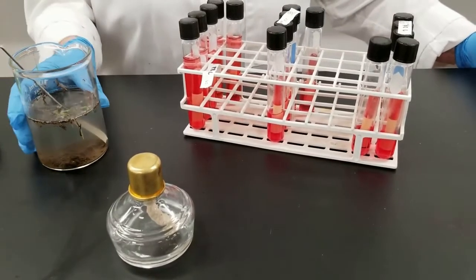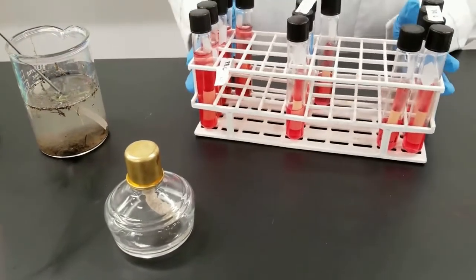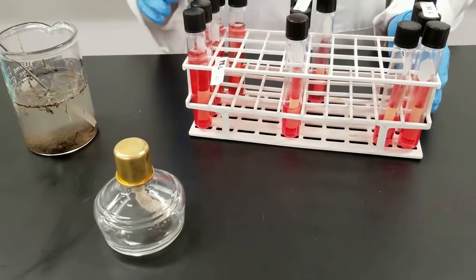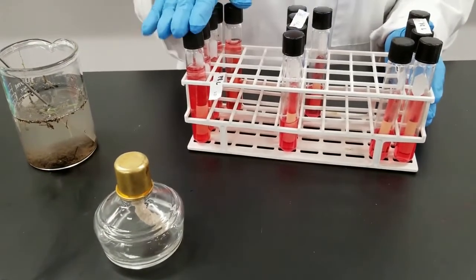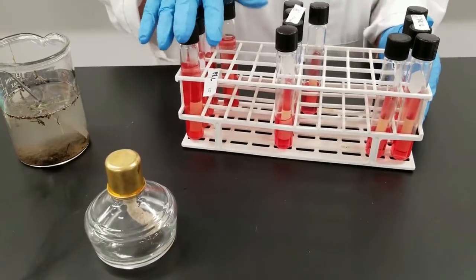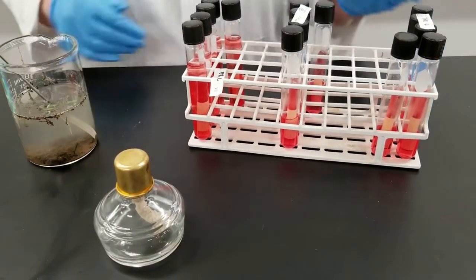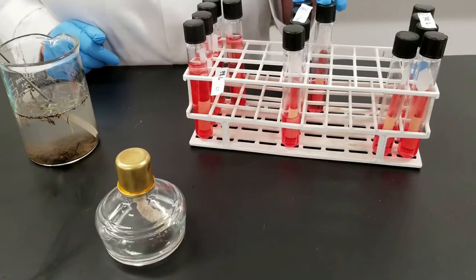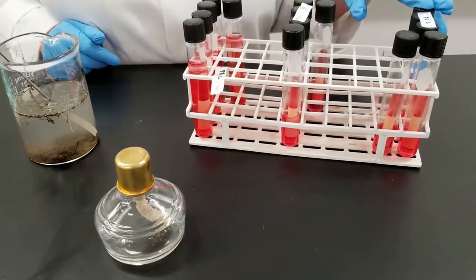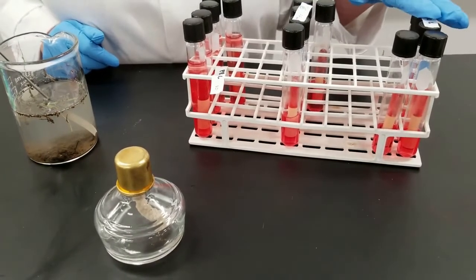So we have a water sample that we obtained. Now I have already inoculated these tubes. They have phenol red in them as an indicator, has lactose, and they're at different strengths. So this is a double strength phenol red with lactose, and in these I put 10 milliliters of water. In this middle section here, we have, once again, the phenol red with the lactose, and I put 1 milliliter of water, and then in the last row over here, I only put 0.1 milliliter of water. So you have 3 different dilutions.